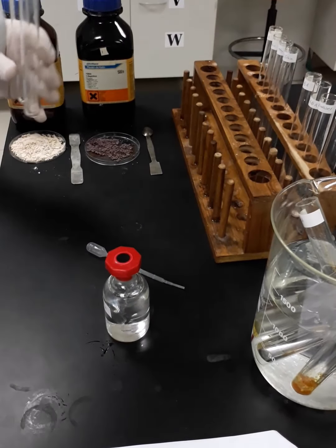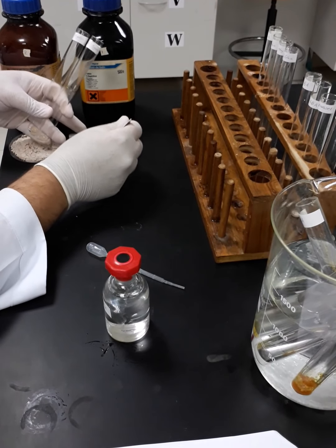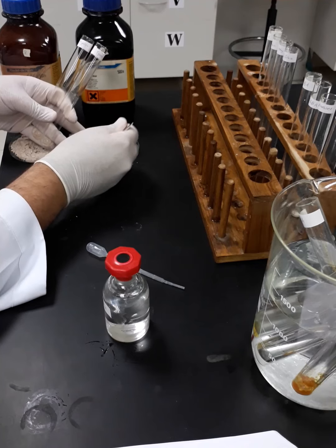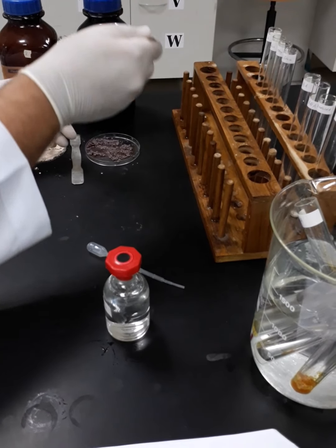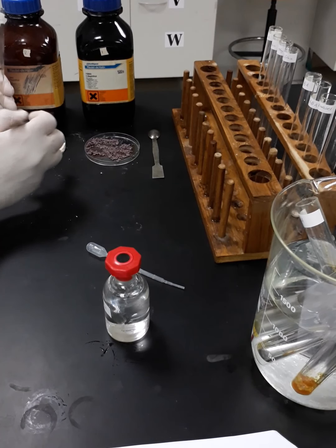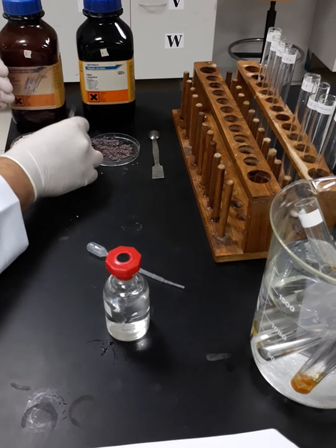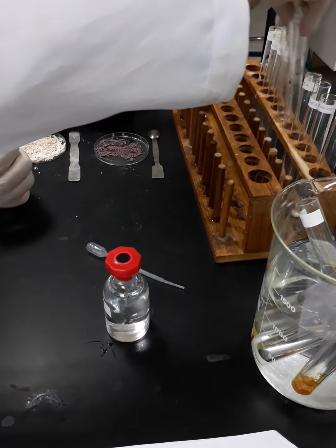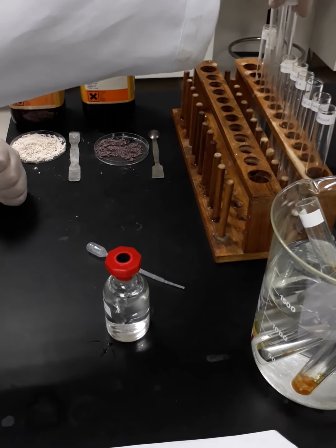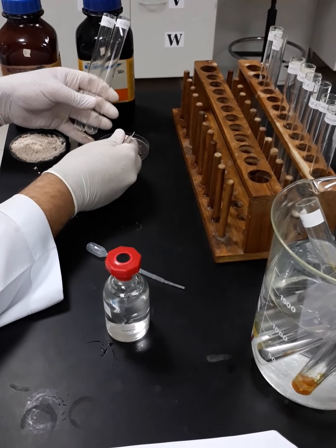Now, once again, for the tyrosine, alpha and beta. The same for diethylamine, alpha and beta.